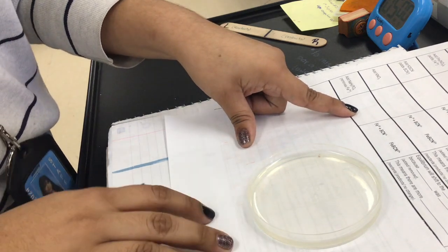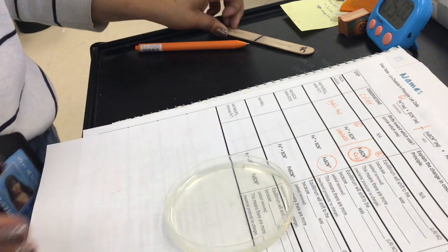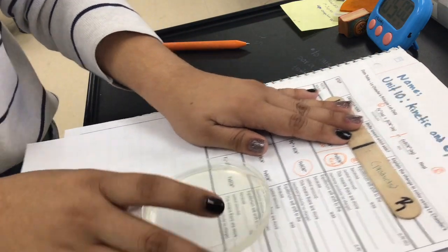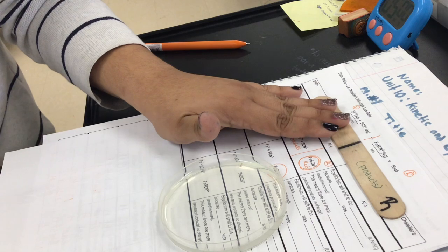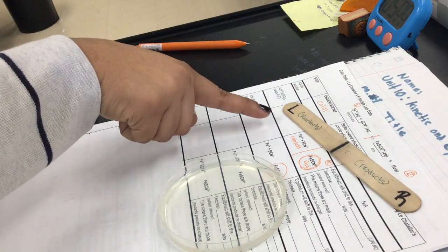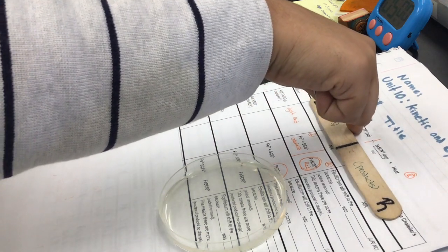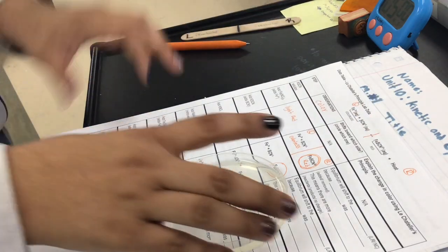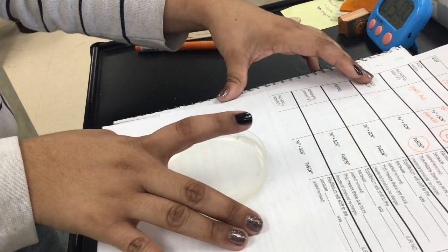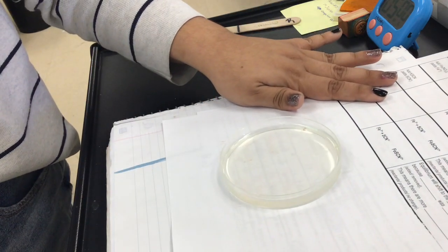Okay, and let's try to make sense of this. So what we did is that we removed some of the Fe. So if we remove Fe, what's the only way to go back to equilibrium? To increase the reactants. And what color are reactants? Colorless. And that's why it changed to colorless. Okay, so that is that one right there.